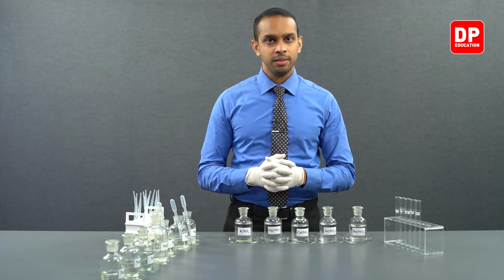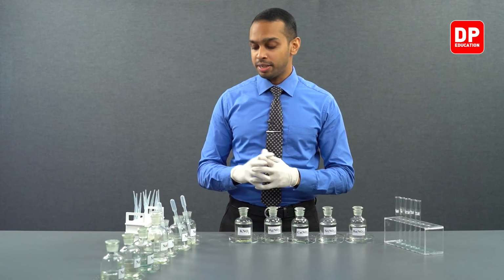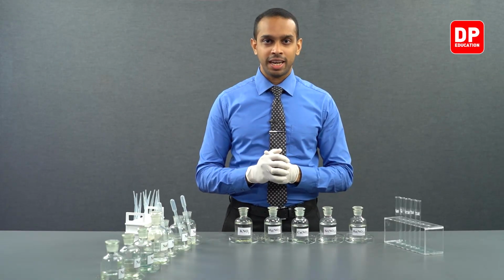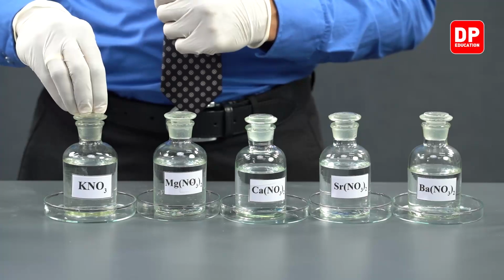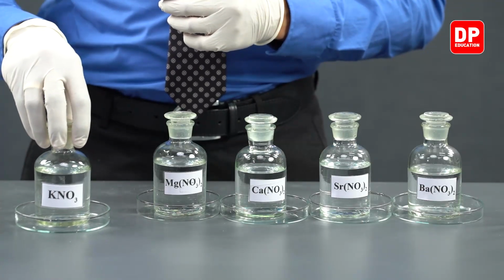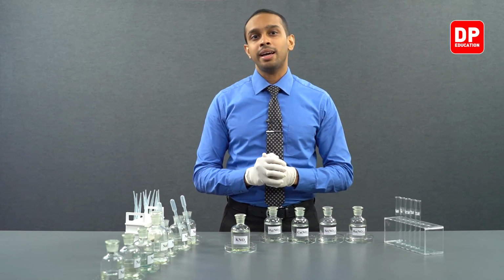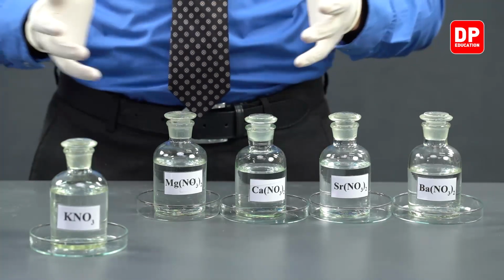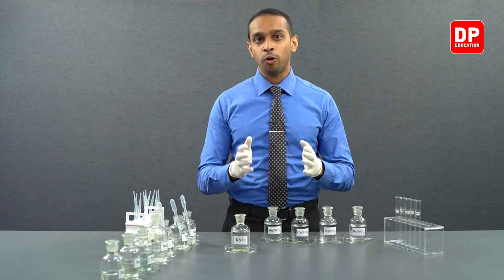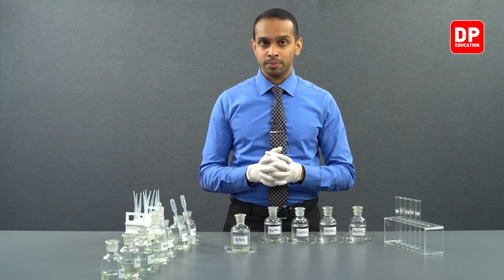In this part of the practical, we will be focusing on taking these cation solutions and reacting them with halide ions. So as you know, we have 5 different cations here, 1 group 1 cation and 4 group 2 cations. As we know, group 1 cations, in this case we have taken potassium nitrate, group 1 cations will react with any common anion and will always form soluble salts. They will form water soluble salts, with the exception of course some salts of lithium that I mentioned earlier.